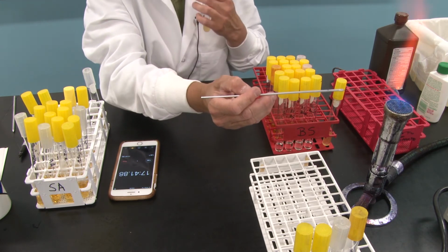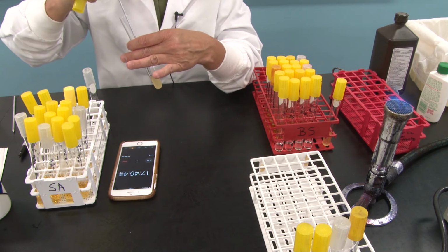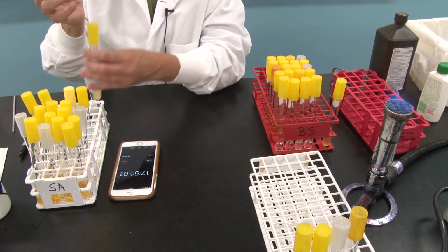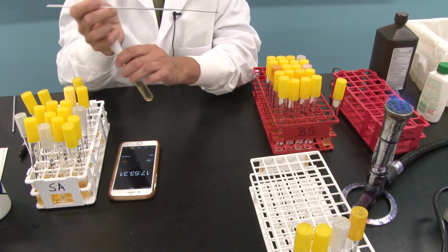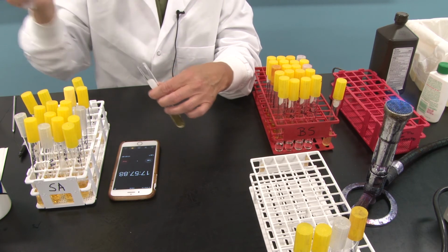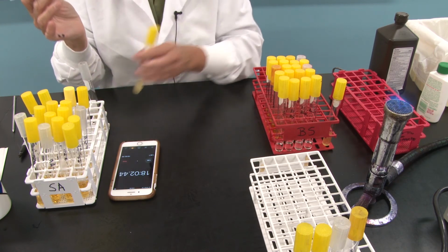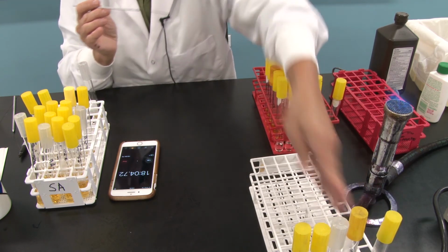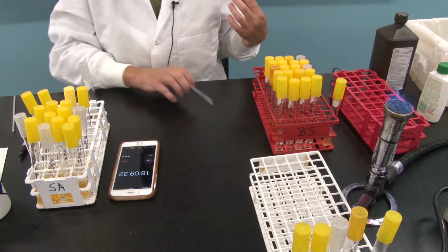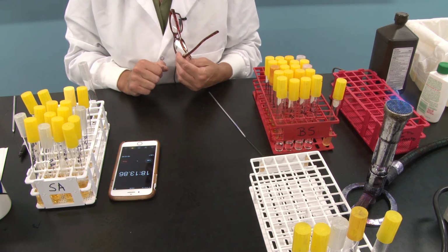Why am I inoculating the control? Because I want to make sure that the bacteria in the stock are viable and that they do, in fact, grow well in this nutrient broth that we made in the last session. Okay? So we will compare all of our other tubes to that control, and I'll put that at the back of the rack. All right, I'll go ahead and finish up the Bacillus subtilis portion of the experiment, and we'll compare both of those when you return.